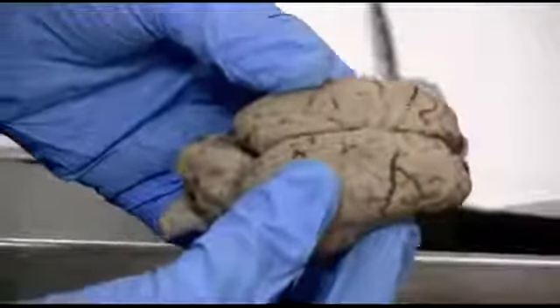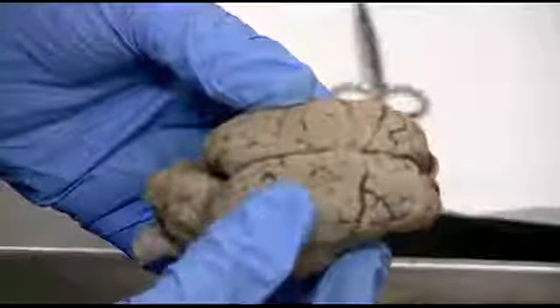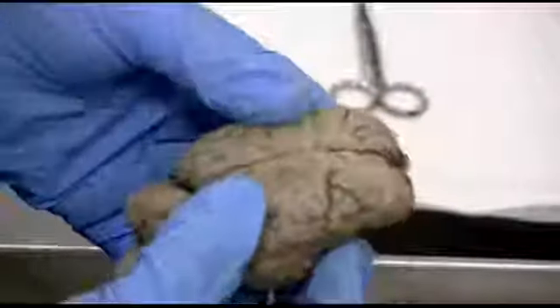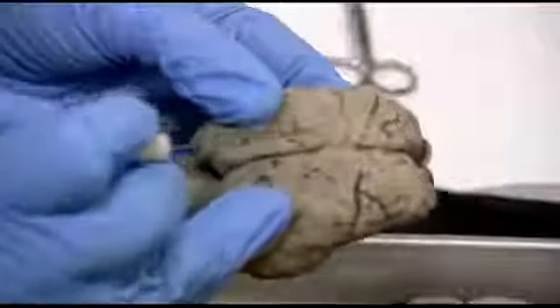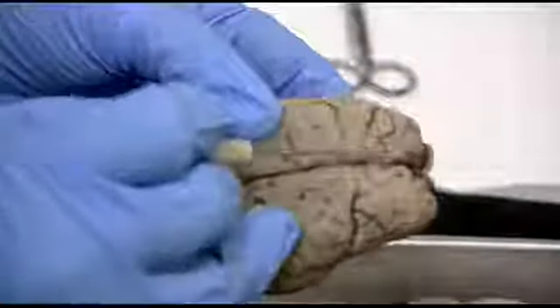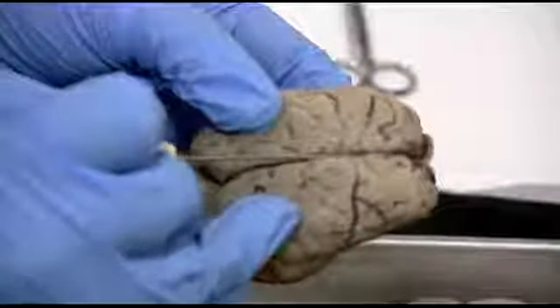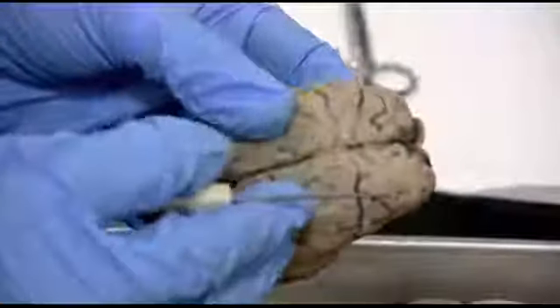Okay, when we are ready to make our mid-sagittal cut down the center, here we have this brain that is already starting to separate at the cerebral hemispheres, and there's a little bit of membranous material here. That's going to be the arachnoid mater and pia mater maybe, left over from those meningeal layers that are still close to the brain. The dura mater is no longer on this brain.